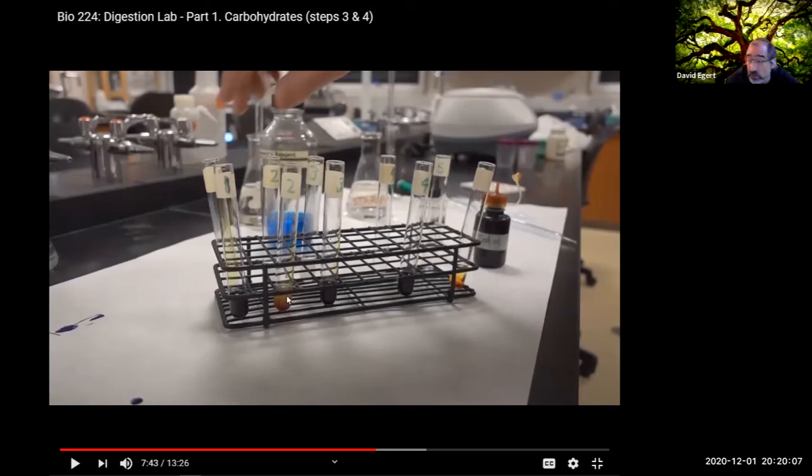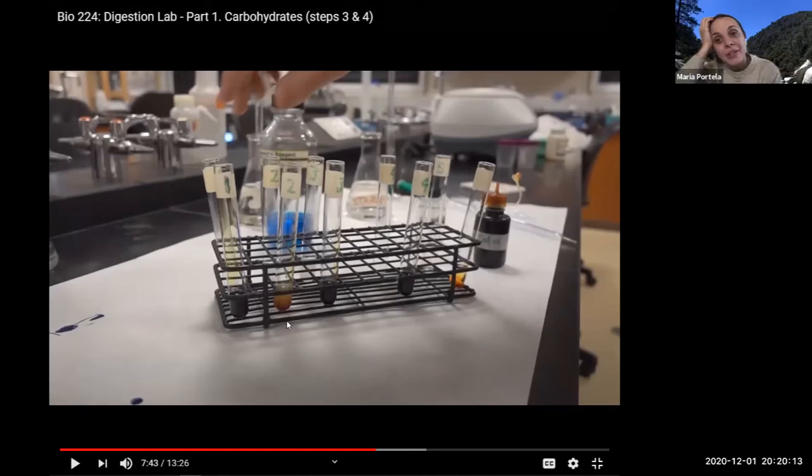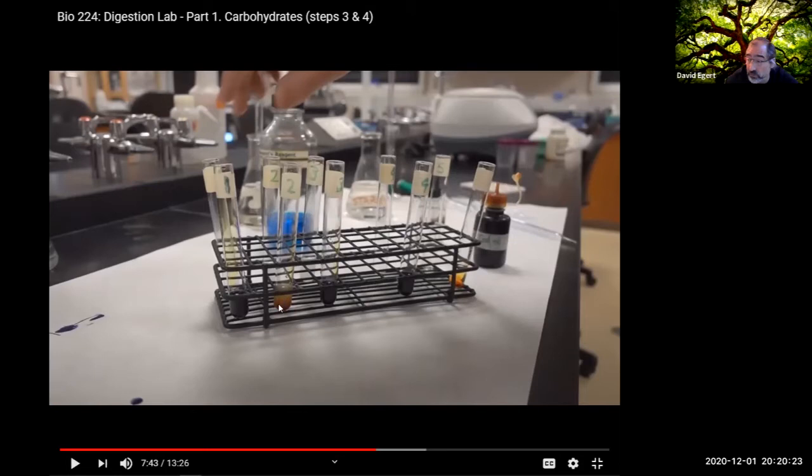Test tube 2, what do we see instead though? It's amber color, which is caused by the breakdown of starch caused by the amylase. Right. So minimally we can say there's really not much starch here because it's not turning blue-black. So that means something happened to the starch. I bet you it broke down.